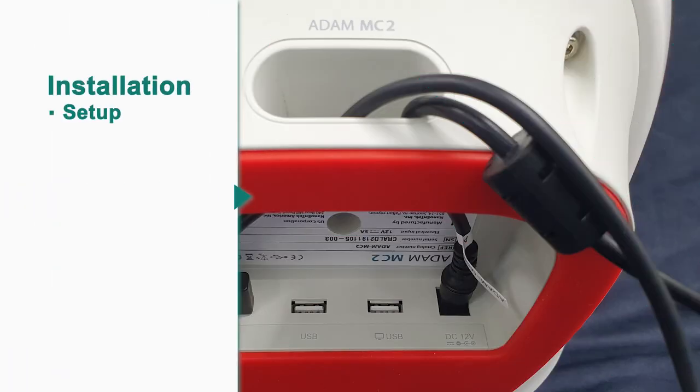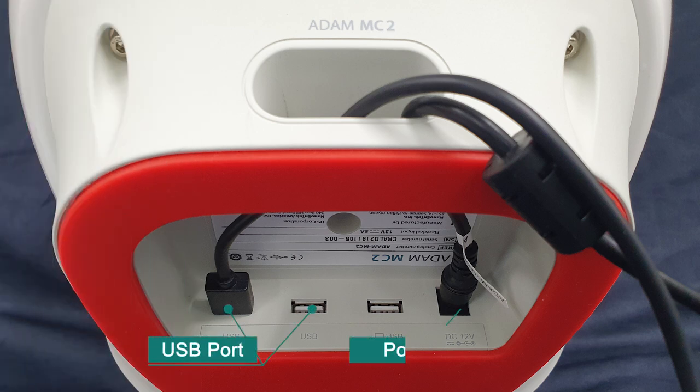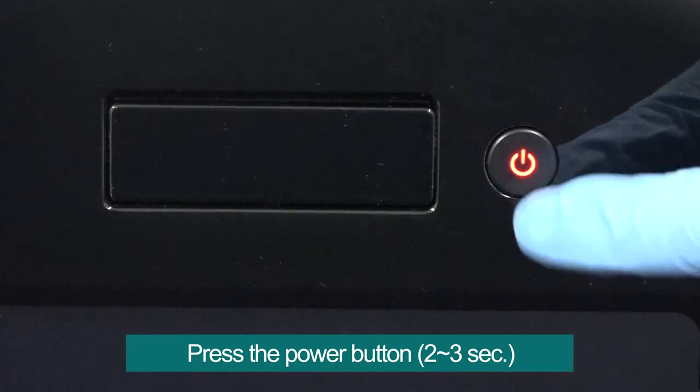First, installation. Plug the power cord at the bottom of the Adam MC2 and press the power button for about 3 seconds.